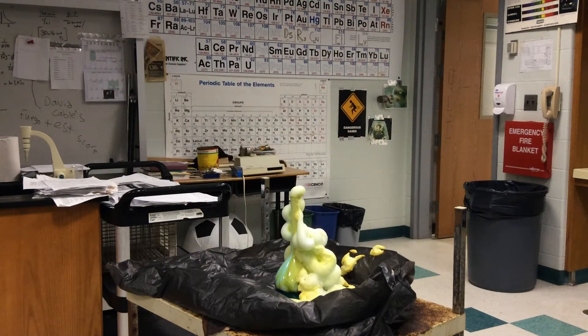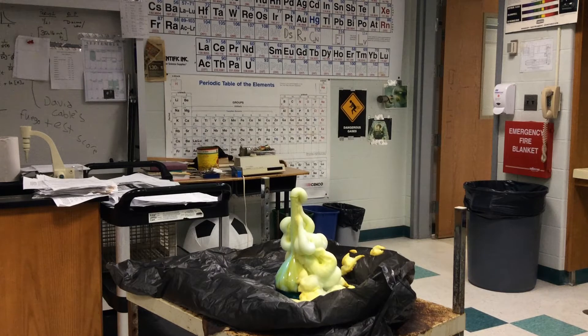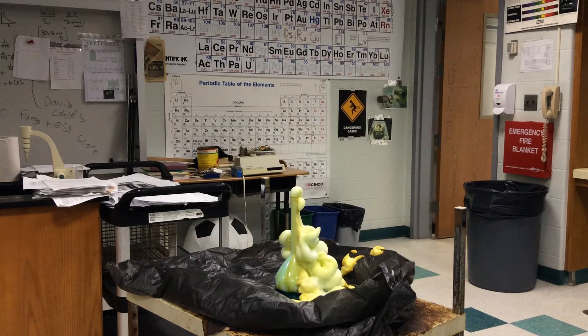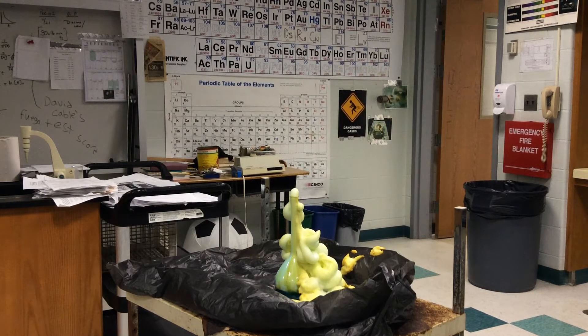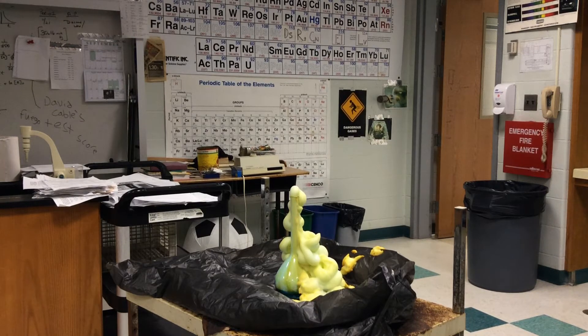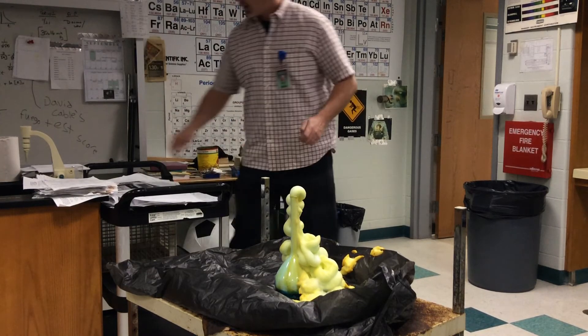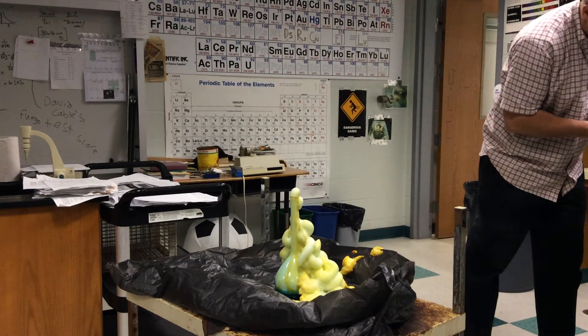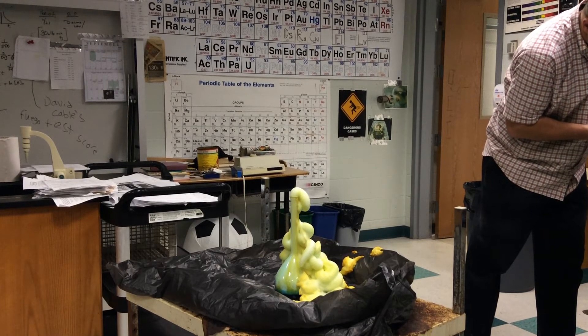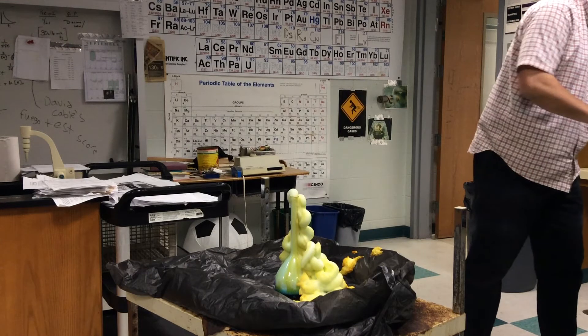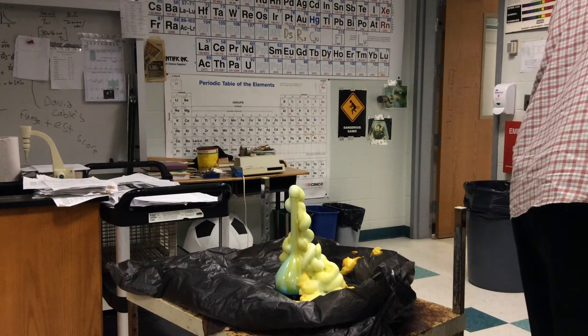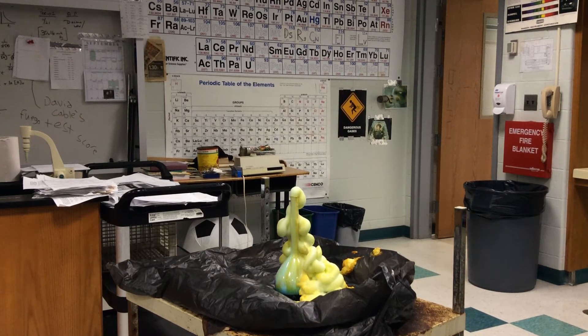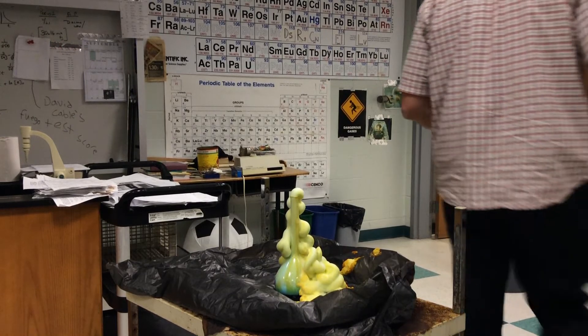Sometimes it gets to the ceiling, sometimes it doesn't. Yeah, exactly. It's still going. Sometimes my hydrogen peroxide is just open enough. Now what I want to show you though, I'll do it one more time. Although I need to make some more catalysts. So I'll try it one more time because I'm not that satisfied either. Okay, but here's what I want to show you though. So let's take some of this potassium iodide. Get some water in here, make it nice and warm. We'll try this one more time. Because if we're not getting to the roof, you're right. It's not that cool.